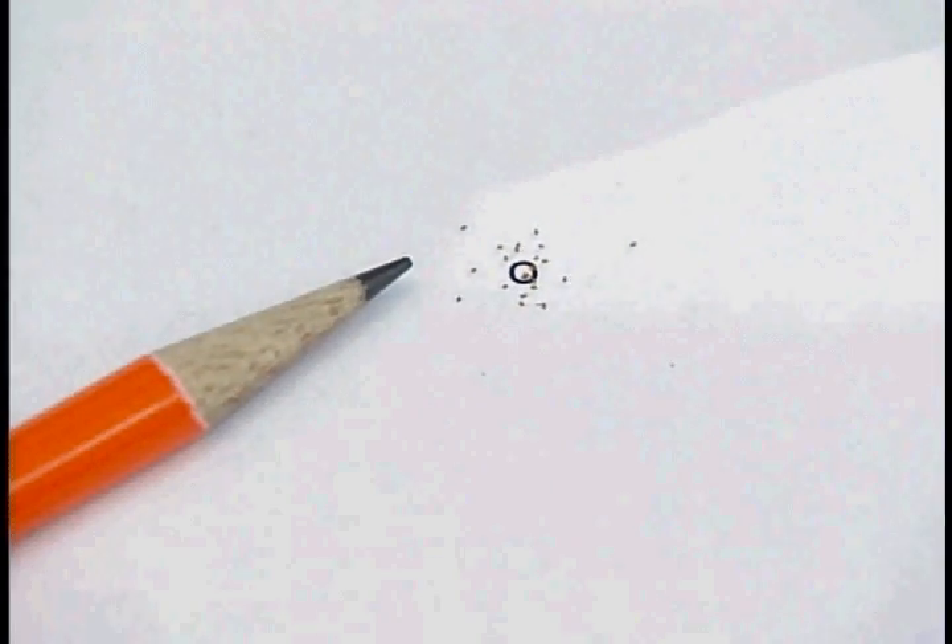That's twelve seeds, but sometimes some seeds don't germinate, so I'm going to count out ten seeds per pot, or twenty seeds total. That's enough to fill a twelve point lowercase o on a sheet of paper.